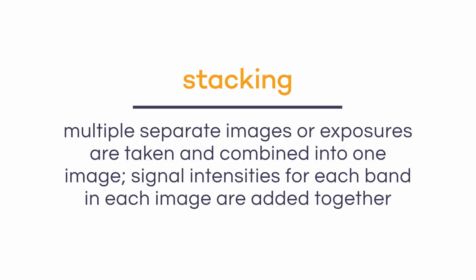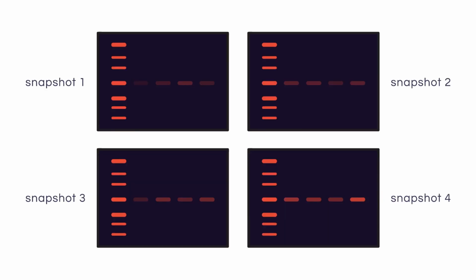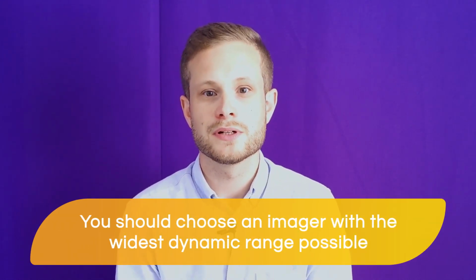Another example of a manipulation that could take place during image acquisition is stacking. This is where, rather than taking one single image of your blot, your system actually takes multiple separate images or exposures, which are then combined together into one image. And typically, the signal intensities for each band from each separate image are added together. This should really be avoided, as presenting or quantifying a stacked image skews the differences between the different signal values, and is not truly representative of your experimental results. This is especially true with chemiluminescence, because each individual image from the stack is a different snapshot in time of a dynamic and changing reaction. Ideally, you'll choose the imager with the widest dynamic range possible, so that all the signals from your blot can be captured in a single image, without saturation and without compromising sensitivity.